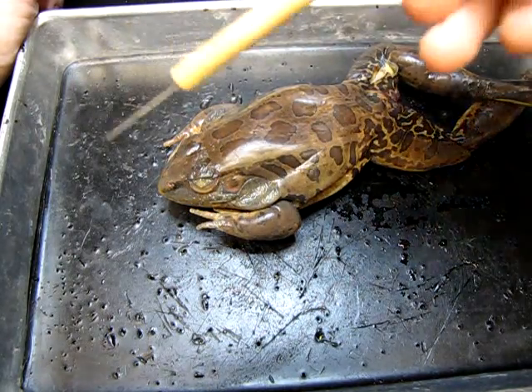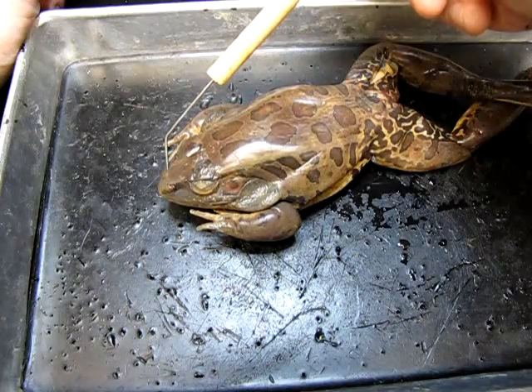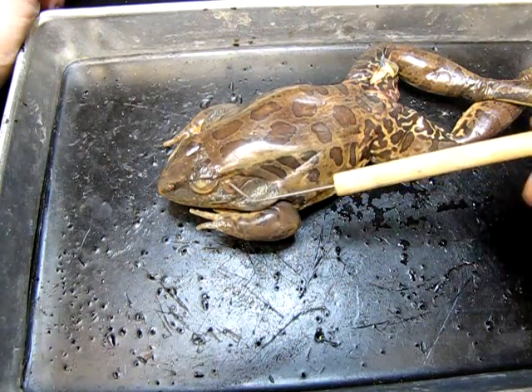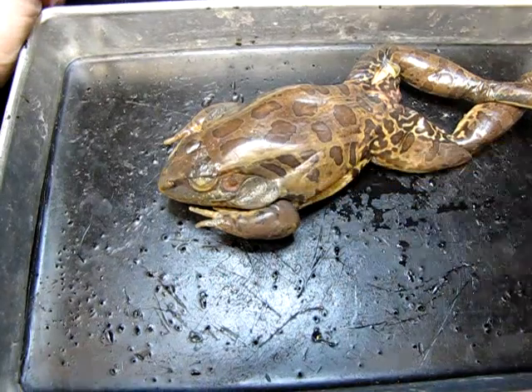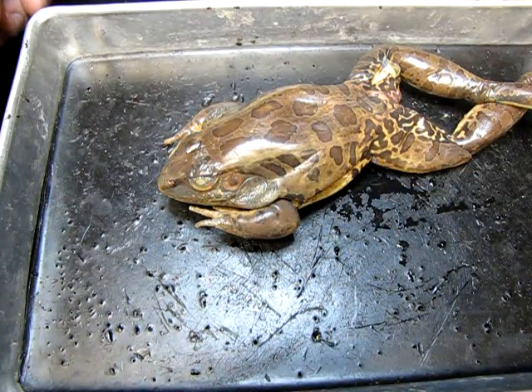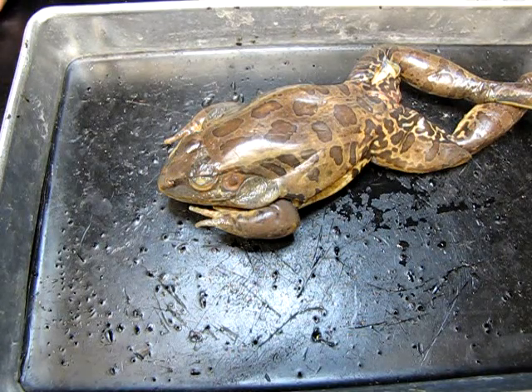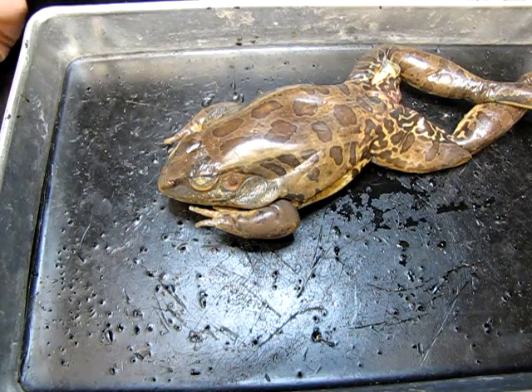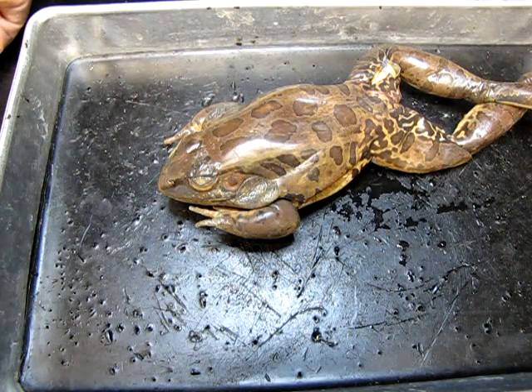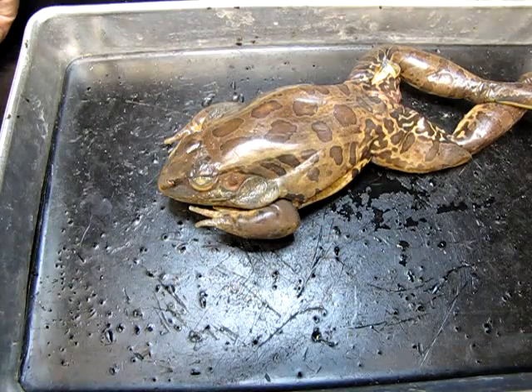The nostrils are visible here and here. And there's this tympanic membrane as well on the side — that's this round structure. The tympanic membrane is used to receive sound. Frogs and toads are similar animals; they communicate using sound, so they need an ear or an eardrum or a surface to receive those sound vibrations.